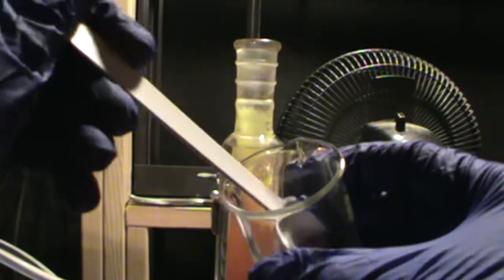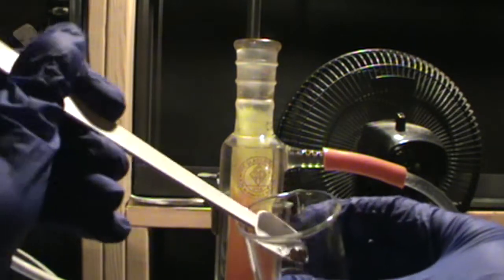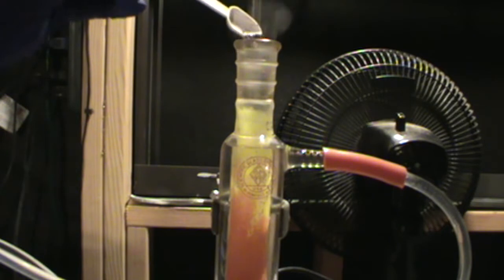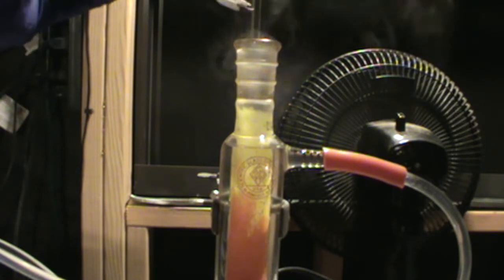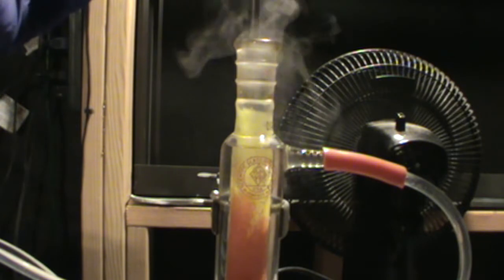Here is a different view of it, looking at it from the top of the condenser. You can see that every time a bit of phosphorus is added, a wisp of phosphorus pentoxide smoke will leave the condenser.